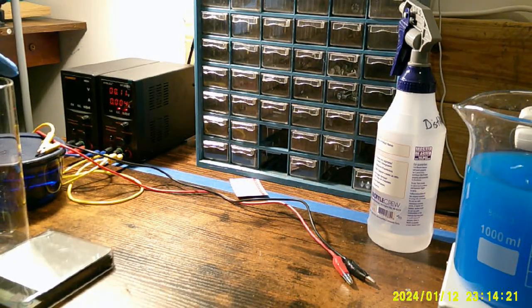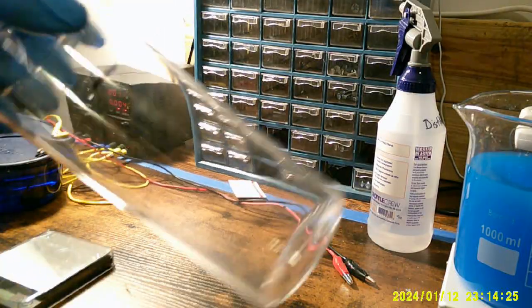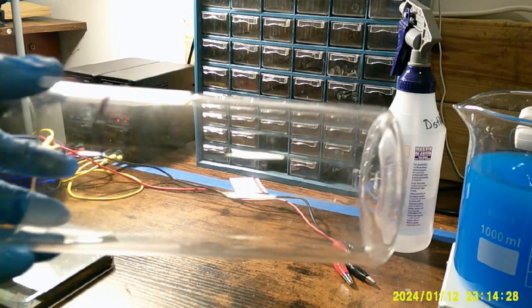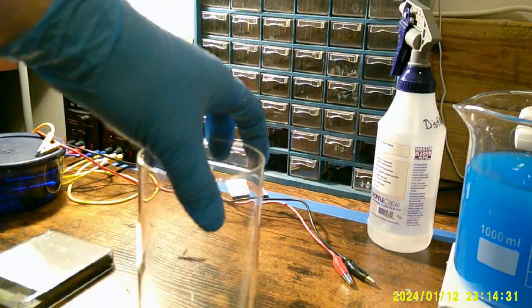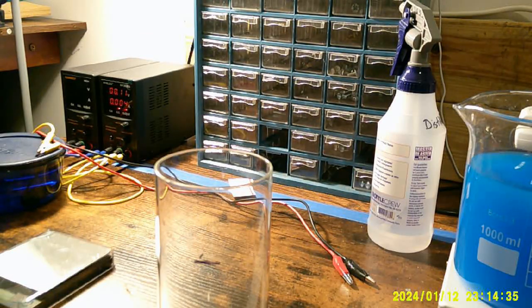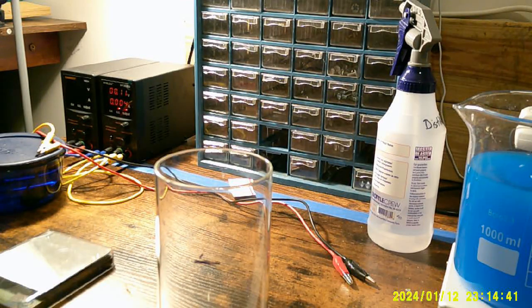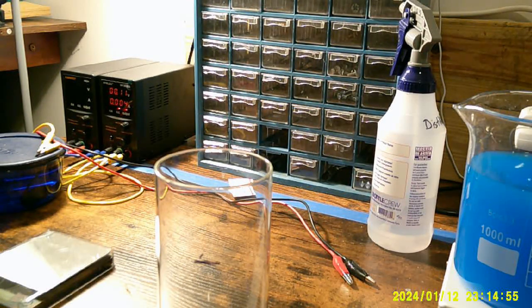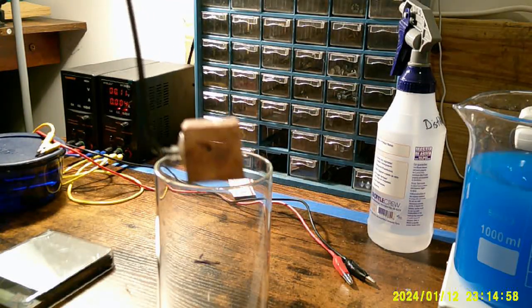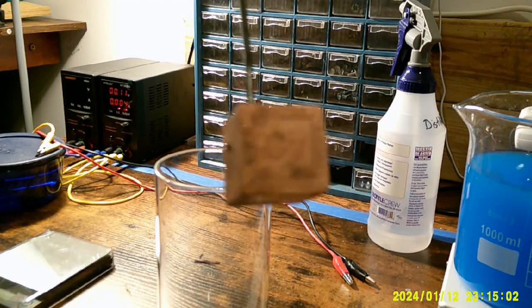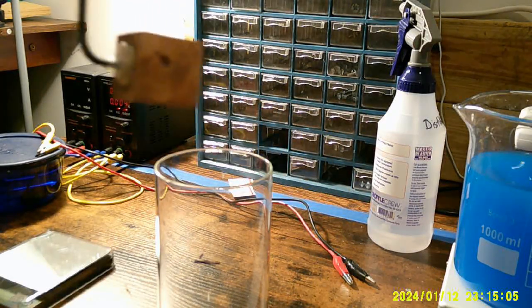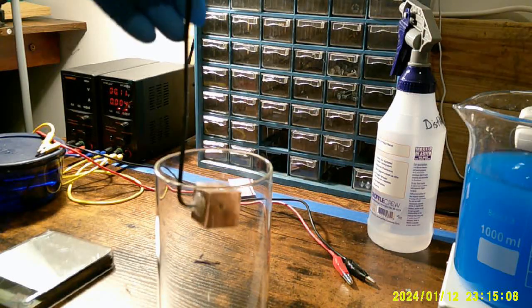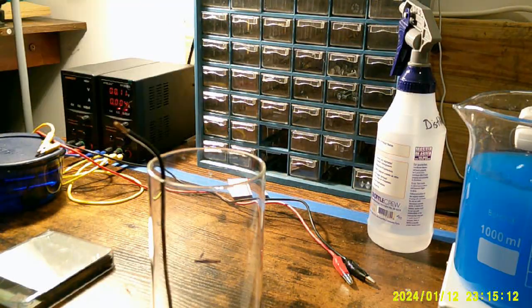I tend to use, or I like to use a variety of containers. In this case, I'm using an eight-inch tall glass container. This allows me to put the cathode where the crystals will accumulate up on top, and the anode where the copper goes into solution down on the bottom. To this, I add what will be my anode. That is a large piece of, well not large, it's like a two-ounce, three-ounce, piece of pure elemental copper down at the bottom.